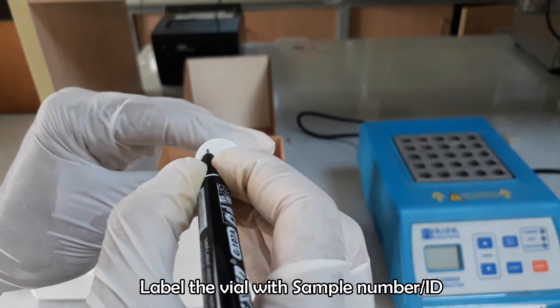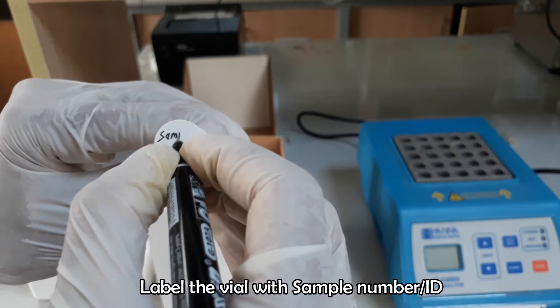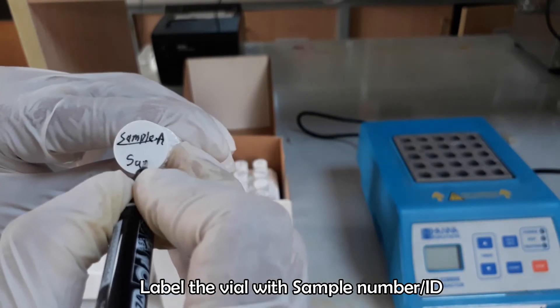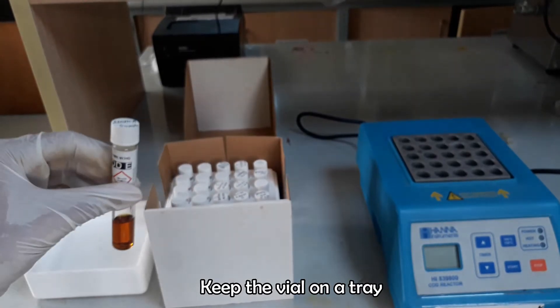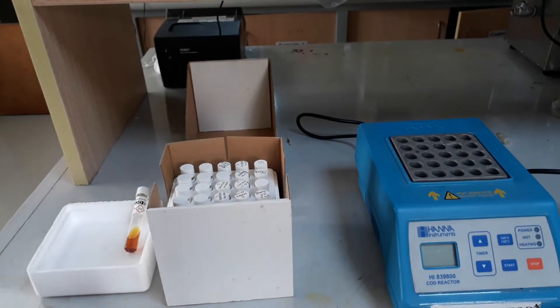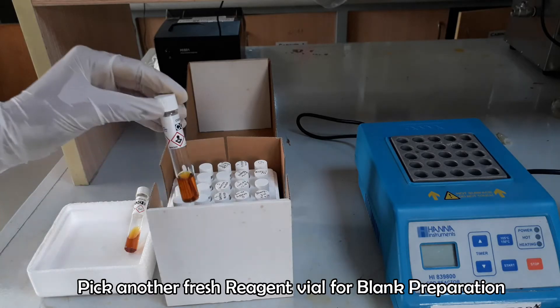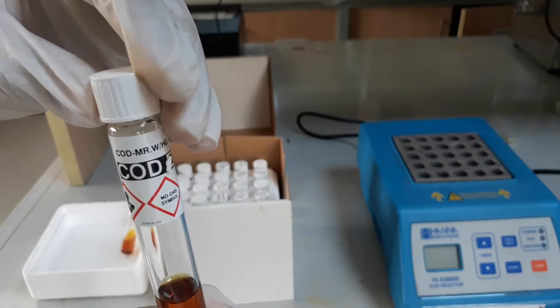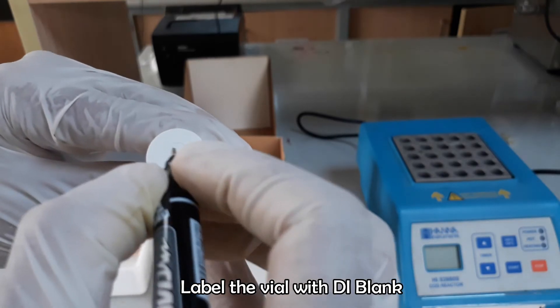Label the vial with sample ID or sample number. Pick another reagent vial for blank preparation and digestion, and label this vial with 'DI blank'.